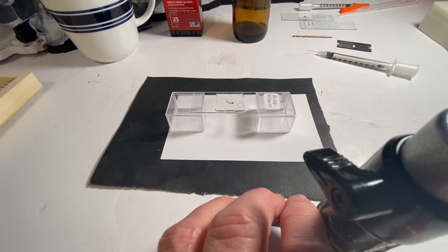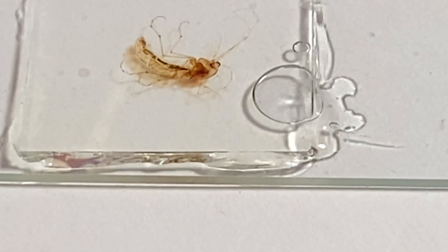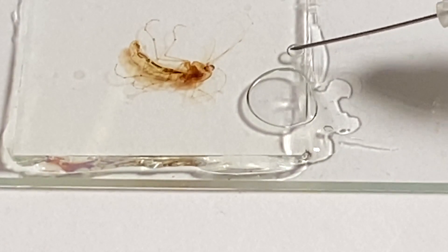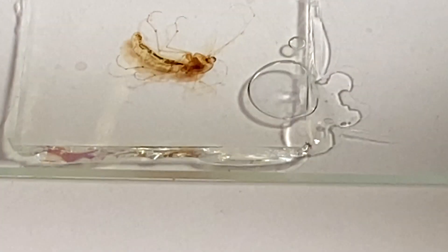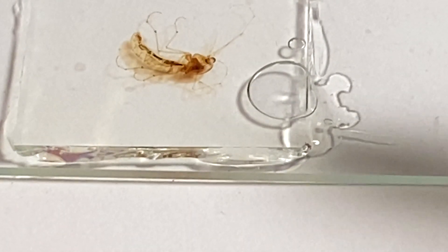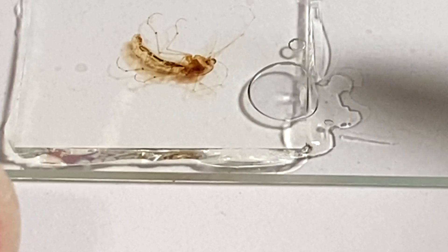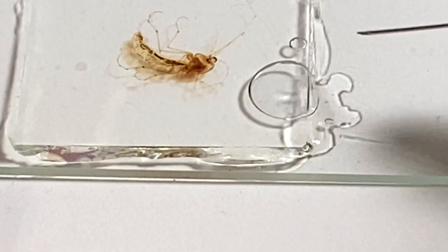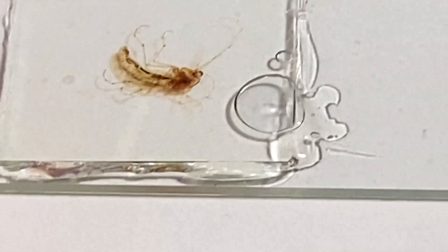So let's take this as a representative slide. I'm going to increase the magnification to about six and put it down on a white background because I think it might show up more clearly. You can see the resin squeezed out here as I applied a weight on it. In one of my previous videos, one of the techniques I developed to keep the slides thin — so you don't have a flat end and a high end — was to put a weight on it. But when you remove the weight later on, if the resin isn't completely dry, it starts sucking air bubbles back underneath.